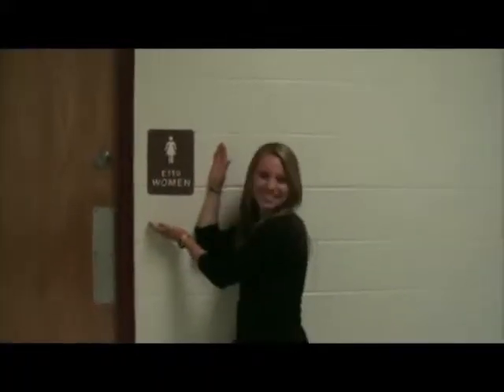Female second. First off, the uterine horns are located on both sides of the vagina as it divides into two parts. This duplex uterus is common in most animals, so they can have multiple embryos. Then the ovaries are connected to the uterine horns via oviducts. The function of the ovaries is to store eggs used to make baby rats.